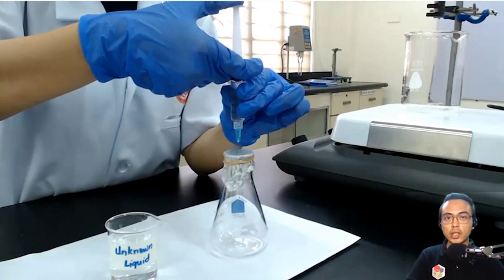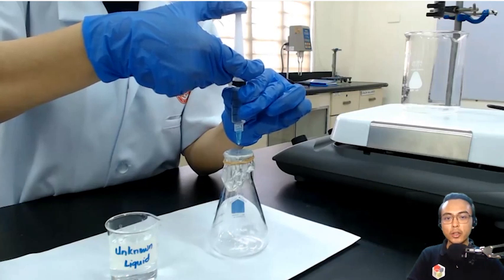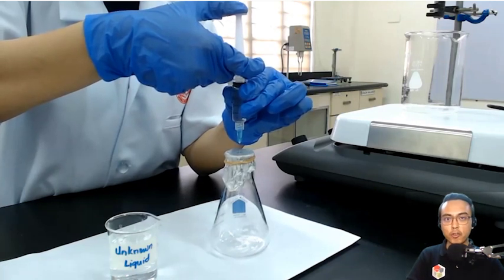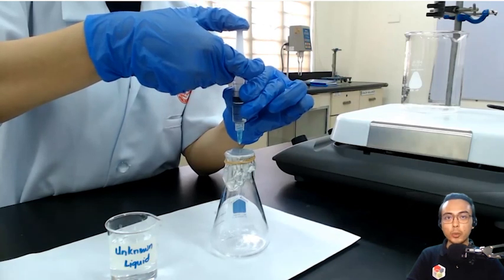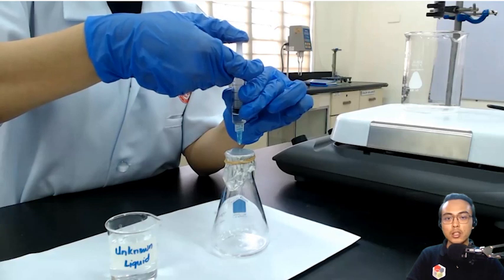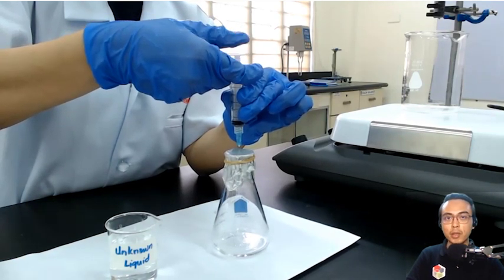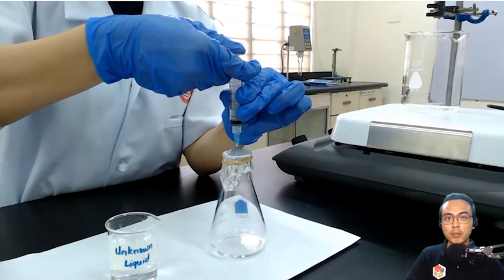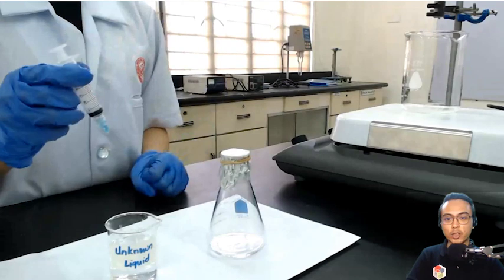Now she is injecting 5 ml of the sample inside the flask. Take note that she is doing that very carefully such that she will not introduce a very big hole in the aluminum foil. You want to have a hole in the aluminum foil to let some of the excess vapor get out, but you don't want the hole to be very big because you will be introducing significant amounts of air inside of your flask, which will affect our reading later.